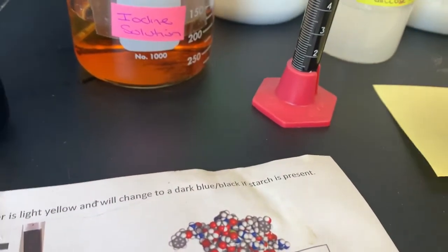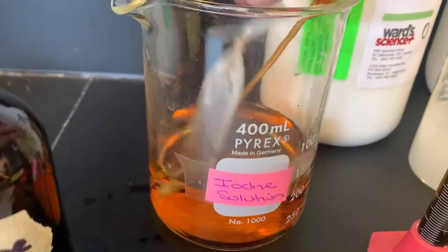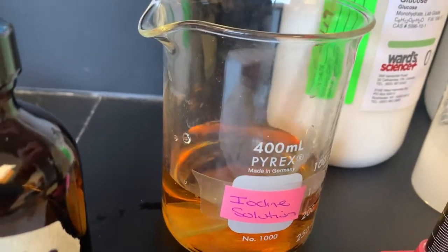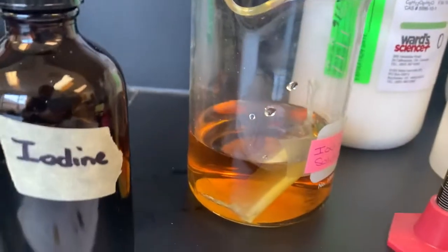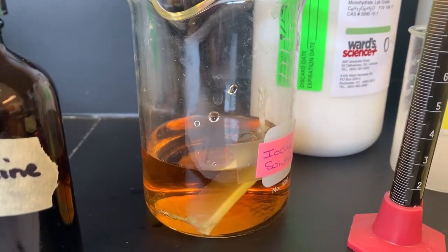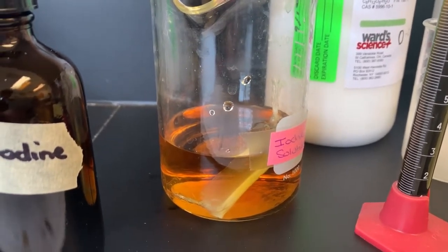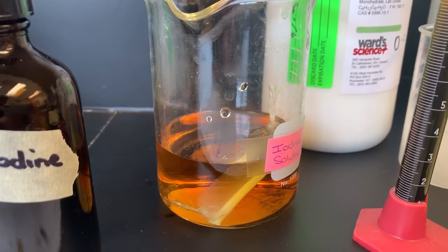Our cell was taken and it was placed in the solution for 30 minutes. And being that we were talking about the cell membrane, we made predictions on which particles would move across the membrane. So in our first part of the lab experiment, we determined whether there was a movement of water in or out of the membrane.